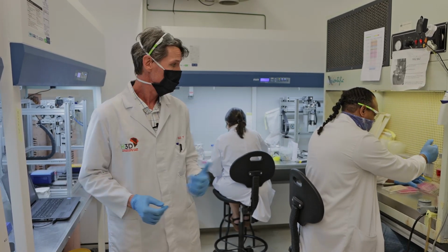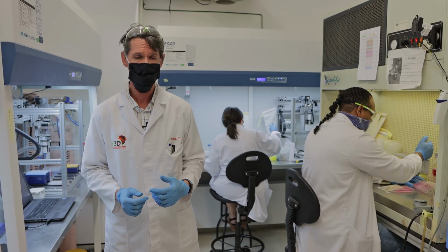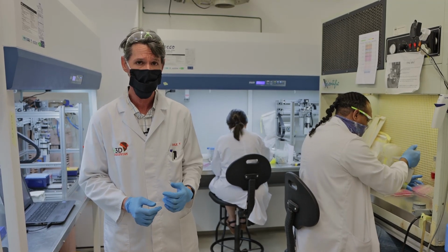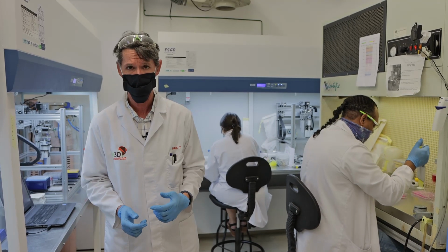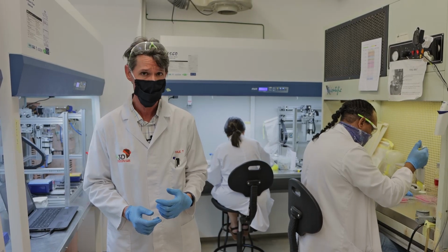In addition to that, my team, who you can see in the background, also look after selectivity, which is an assay that we run to make sure that the compounds are active only against the pathogen that they're supposed to be intended for and are not generally toxic to mammalian cells, which is what something like bleach would do. This is an important part of testing to make sure that our compounds are actually safe.